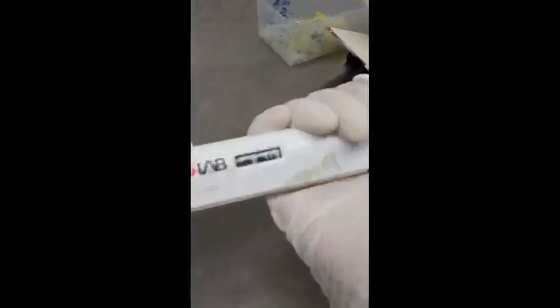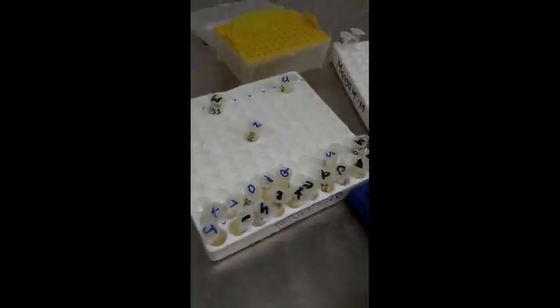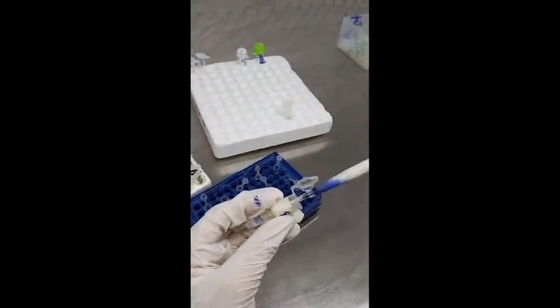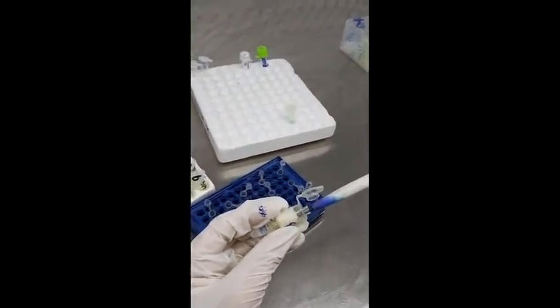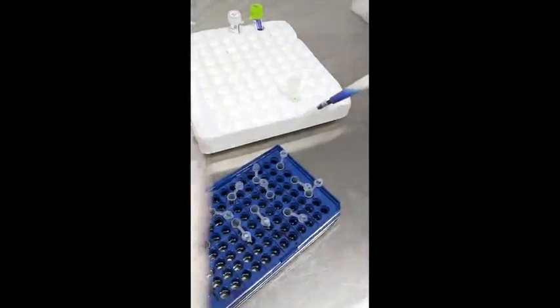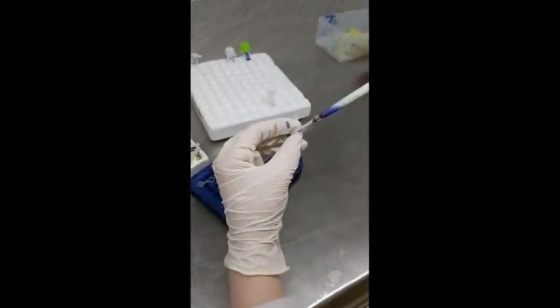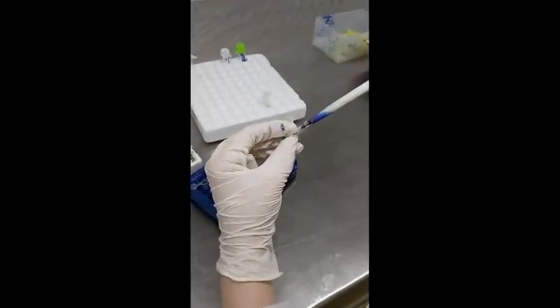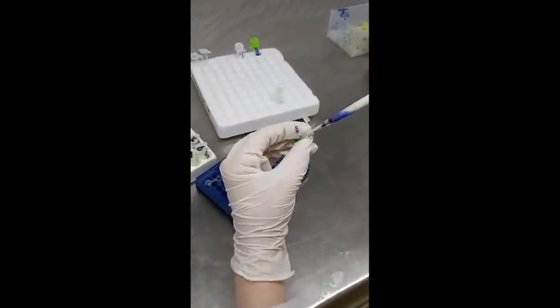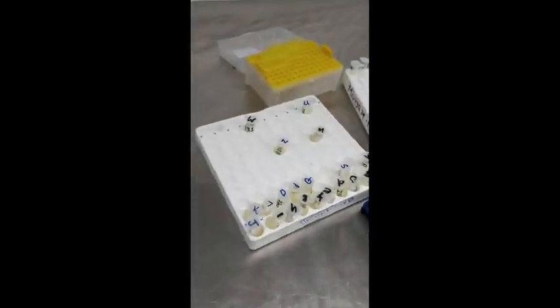Now add one microliter of your sample DNA into each tube. In this particular case we have extracted DNA from bacteria — we are working on the antibiotic resistance genes of these bacteria — so you will be adding one microliter of DNA into each tube. Mix them well so all contents are well mixed before you run them in the PCR.